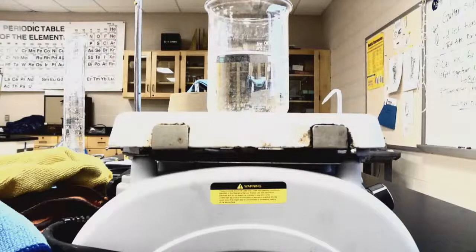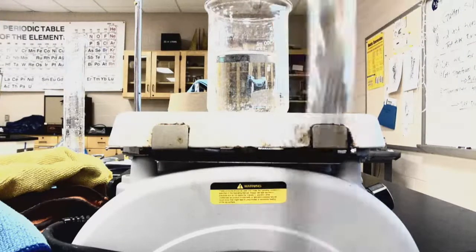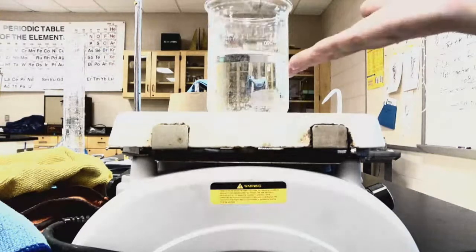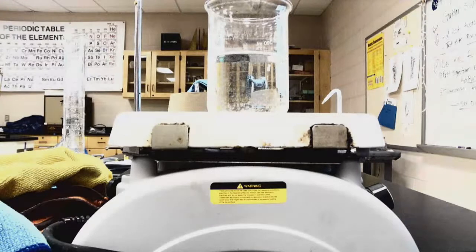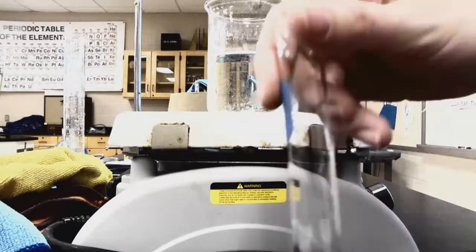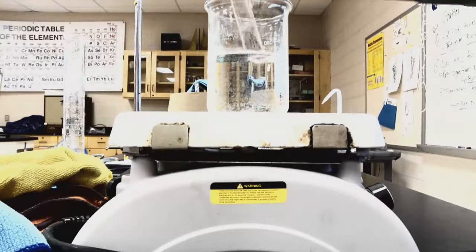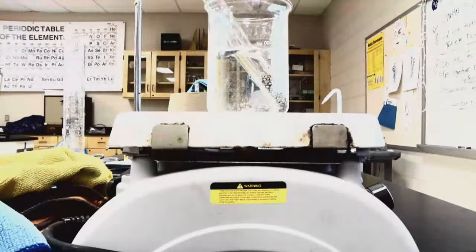All right, so now that I've got my metal in my test tube, I'm actually going to add this test tube of metal, and it's only metal in here, into this beaker of water on a hot plate. And what I'm going to try to do is get the temperature of this metal up to the boiling point of at least water. So I'm going to set this in my hot water bath, and I'm going to heat it up with boiling water, and I'm going to then let this metal sit in this boiling water for 10 minutes.